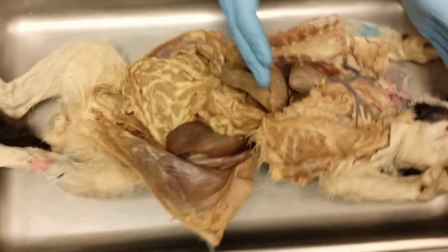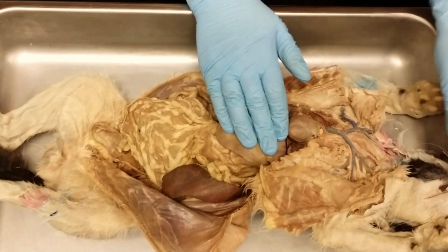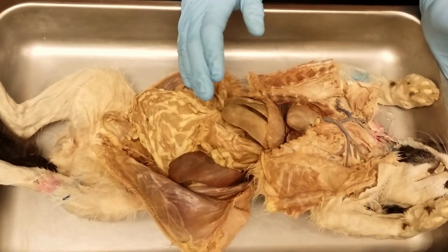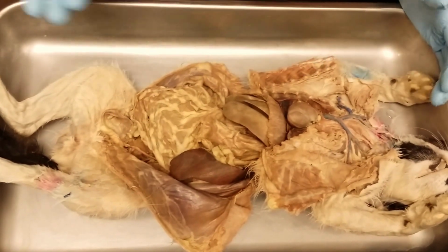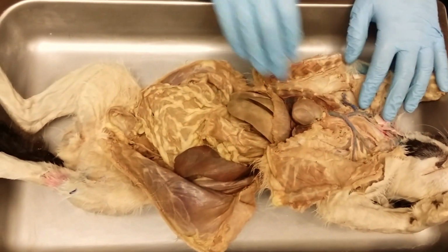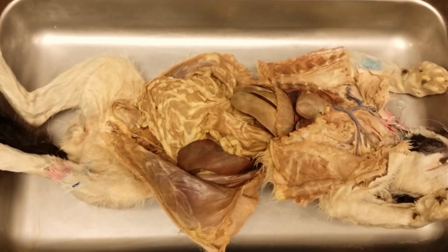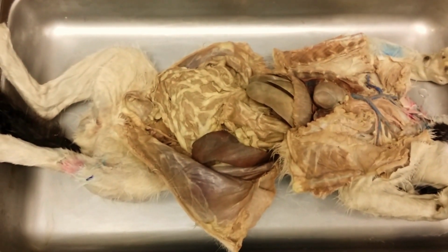So as far as up in the thoracic cavity, the superior part of the body, you should be able to identify this. This is the oral cavity, so don't tell me mouth, oral cavity. And then teeth and tongue, you should be able to identify those structures, but also know how they participate in digestion. The only other organ that you need to be able to identify on the cat, now this is just the cat. Everything else you should be able to identify on models and microscope slides.